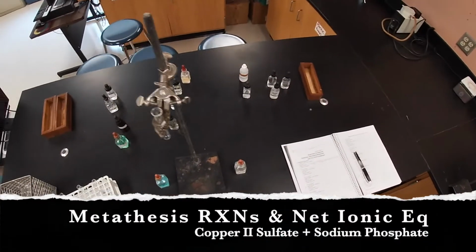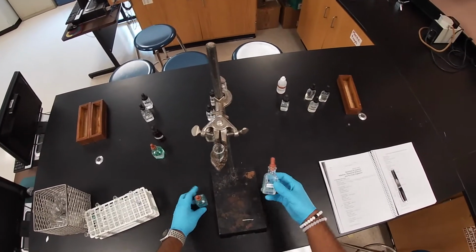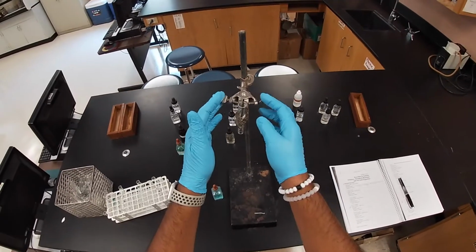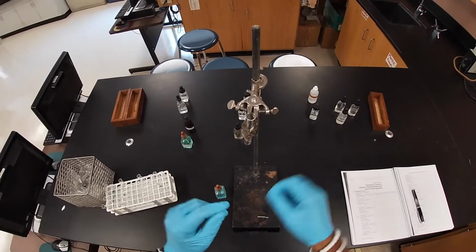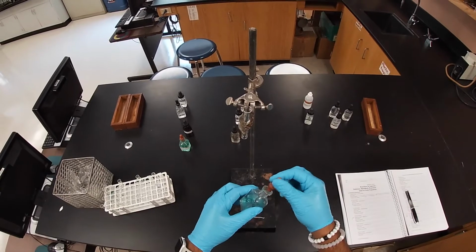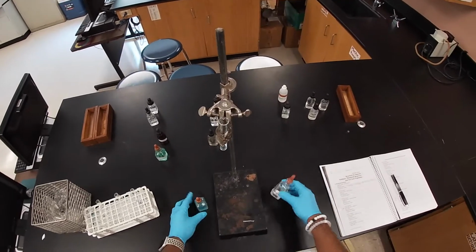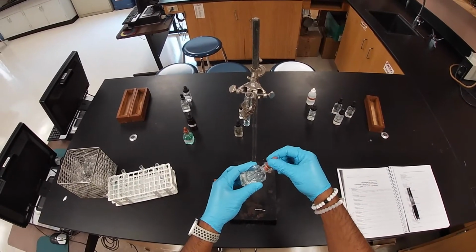Our third reaction is again copper sulfate. This time we're going to react it with sodium phosphate. Hopefully I'm not zoomed in too much. Again, we got our setup with our test tube clamp, and we are getting our test tube. That way I can add freely and I don't have to squat down. So we have a clear solution. We're going to add a dropper full. And then here we get our sodium phosphate, and we're going to add a dropper full of this.